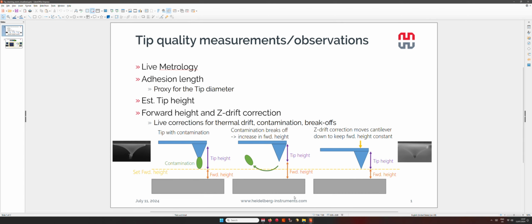So all across this field, we want to use always the same forward height. So what happens if we have some contaminations or blunting or some thermal drift? Well, we have this Z drift correction. So basically, in this case, we have a contamination when we start writing, and then we set this forward height, but then during the patterning, this contamination can break off, and this means that our tip height decreases, so the forward height increases. So we have to lower the Z piezo scanner in order to go back to our forward height. In this case, you can see also a SEM image of a tip when it's contaminated and after it's cleaned during patterning, for example.